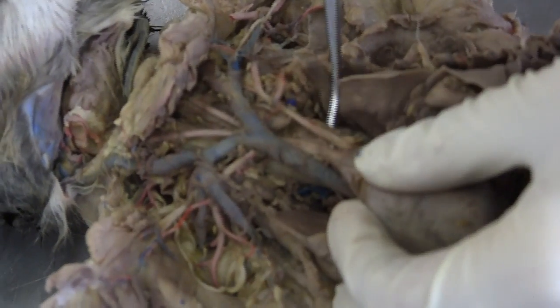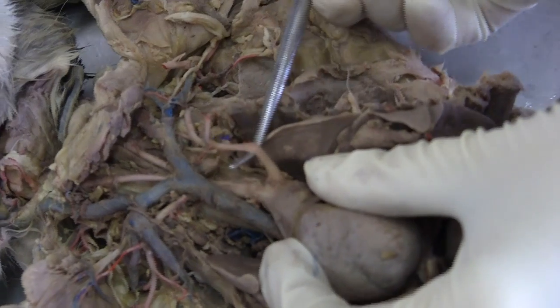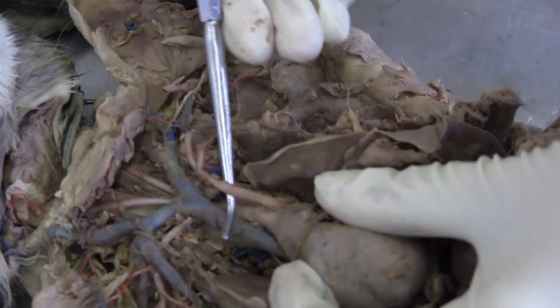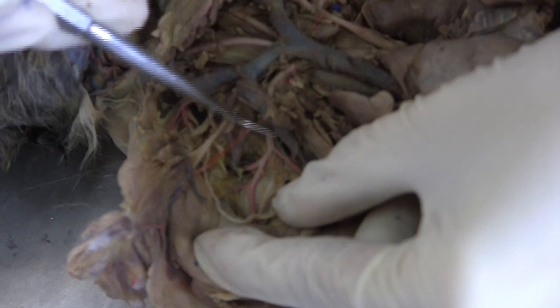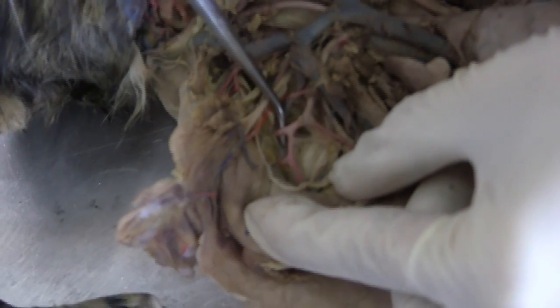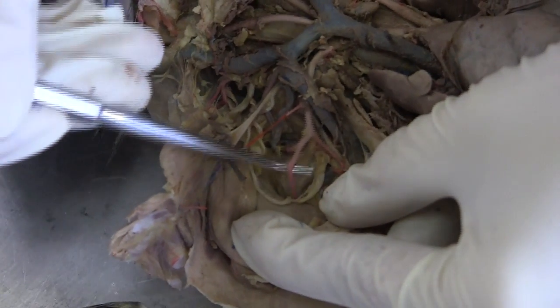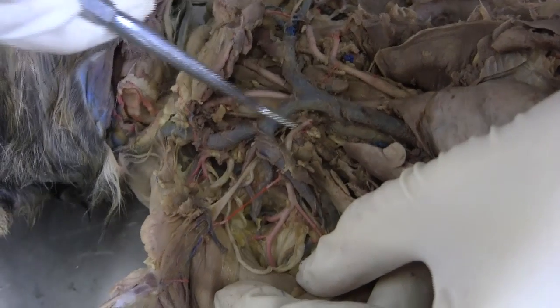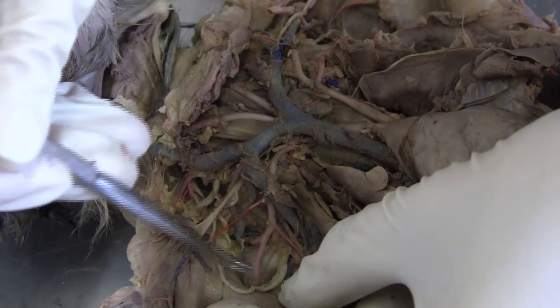And the left subclavian is the other branch from the aorta — this one, left subclavian. So right subclavian, and this one is the axillary, and here is the subscapular, and the middle one is the brachial. So it's brachiocephalic, right subclavian, axillary, subscapular, and brachial.